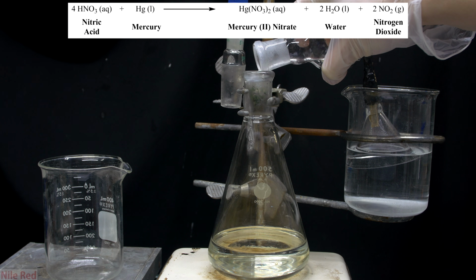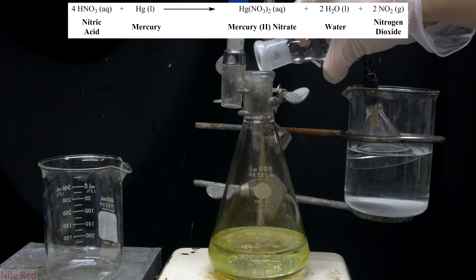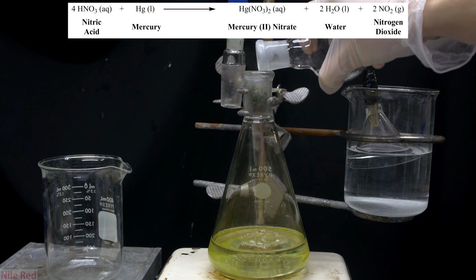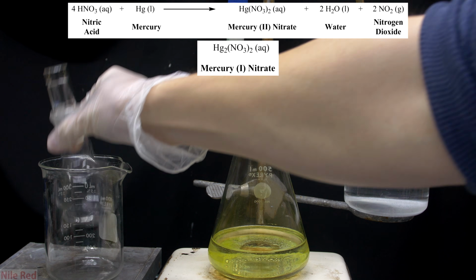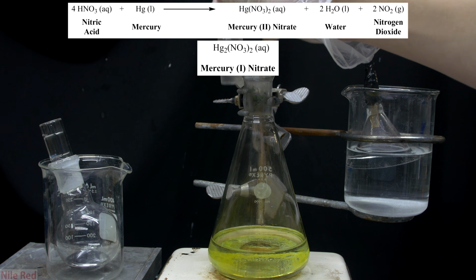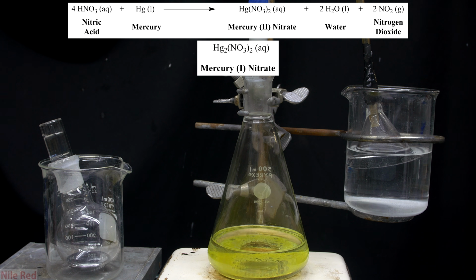As the mercury is poured in, we can see that it immediately starts reacting with the nitric acid. The reaction here is pretty simple, and what's happening is the mercury is reacting with the nitric acid to form mercury 2 nitrate. The mercury 2 nitrate is our desired product, but to some degree we are going to be producing mercury 1 nitrate. There's a very easy way to deal with this, and I'll show what we do in a bit.